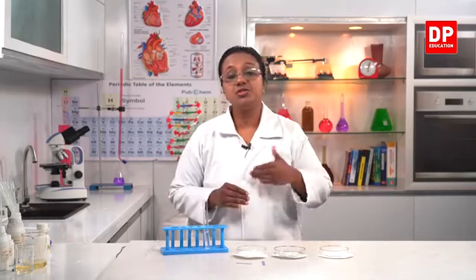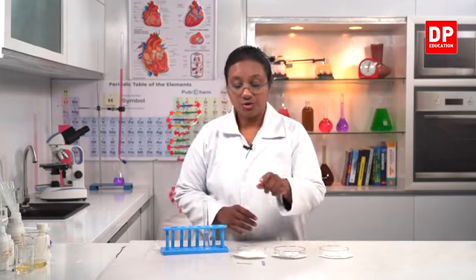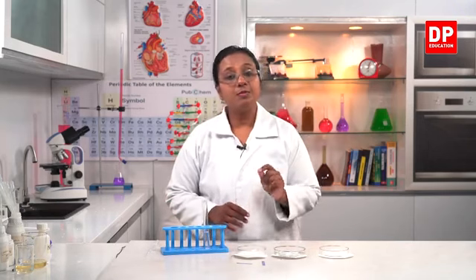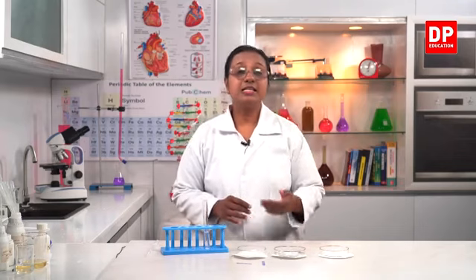So, using this, you can easily identify bases. But here, you cannot use the litmus paper to identify whether it's a strong base or a weak base. We can only identify whether it's a base or not. So, red litmus becoming blue color means it is a base, or the bases turn red litmus to blue color.